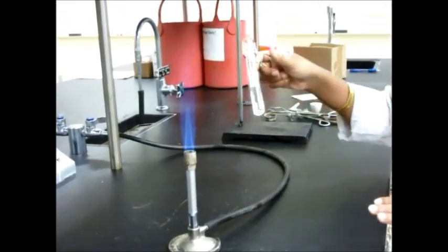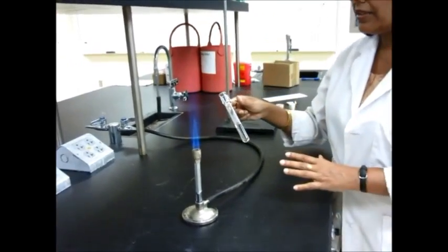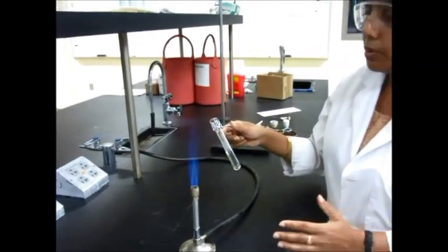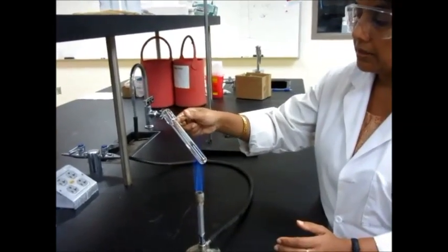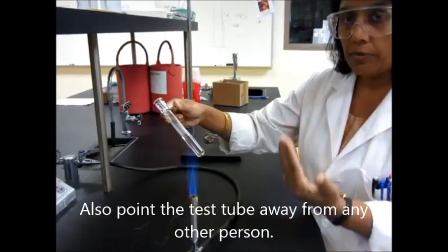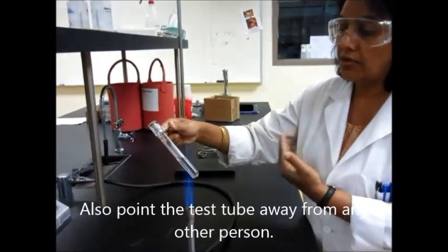Regarding heating the test tube itself, you can have whatever flame you want. However, when you heat a test tube, you want to make sure that you keep it at an angle away from you, away from your face, so that if anything has to splatter out, it doesn't splatter on your face.